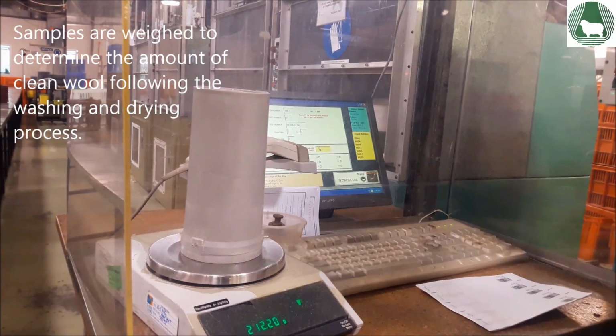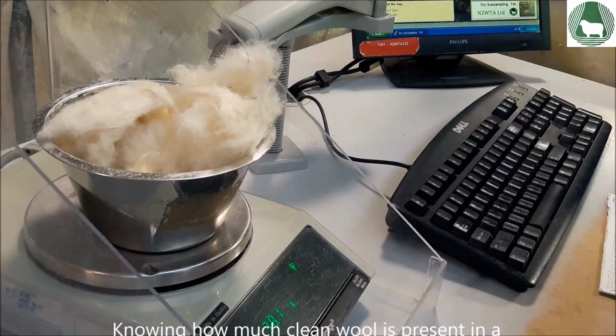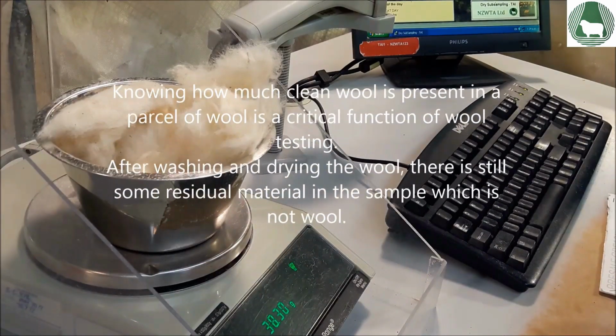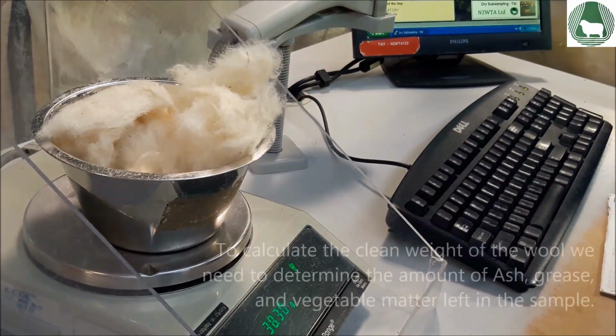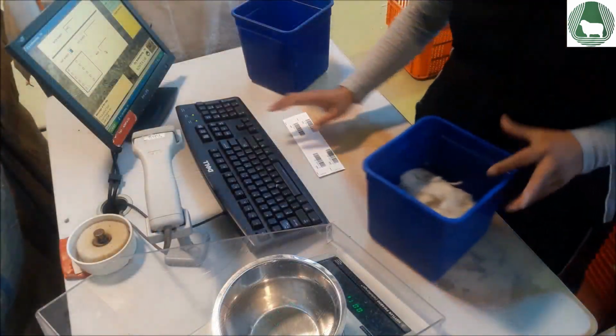Once the samples have been washed and dried, they are weighed to determine the amount of clean wool following the washing and drying process. Knowing how much clean wool is present in a parcel of wool is a critical function of wool testing. After washing and drying the wool, there is still some residual material in the sample, which is not wool. To calculate the clean weight of the wool, we need to determine the amount of ash, grease, and vegetable matter left in the sample.